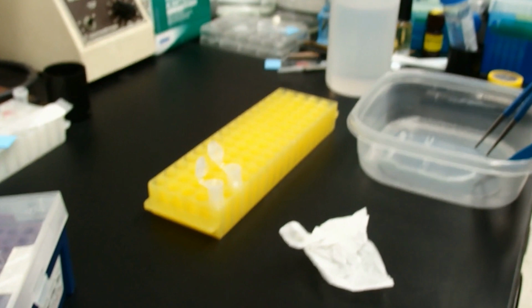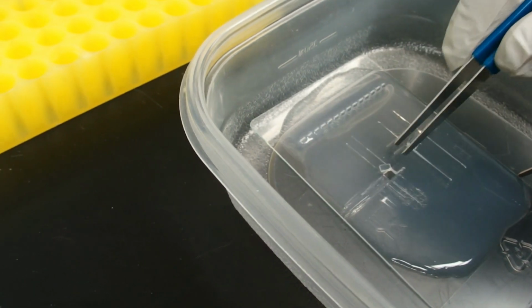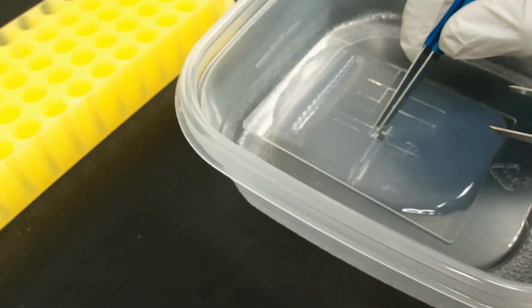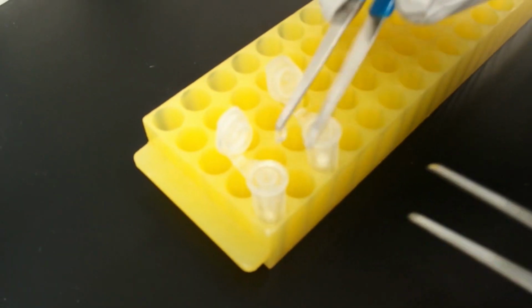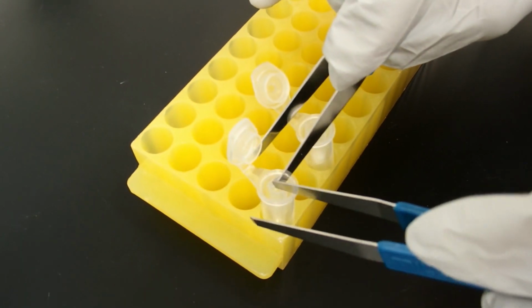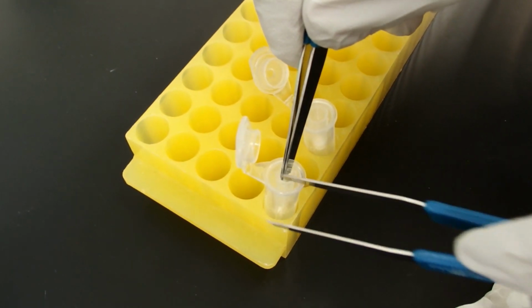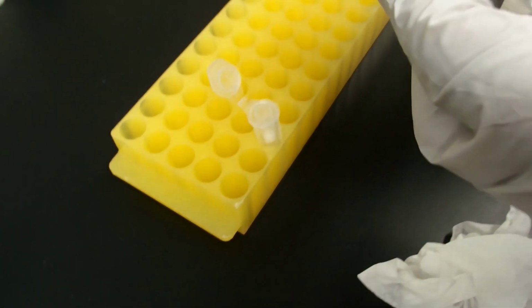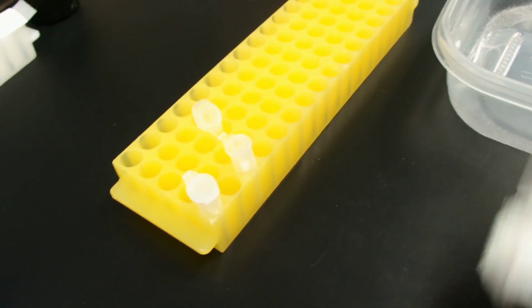I have two different pieces of agarose gel that I've already cut on the transilluminator. This small piece I'm going to put into our small reservoir cup. Put this in here. It doesn't have to go all the way in, it just has to be in there. And I'm going to close this.